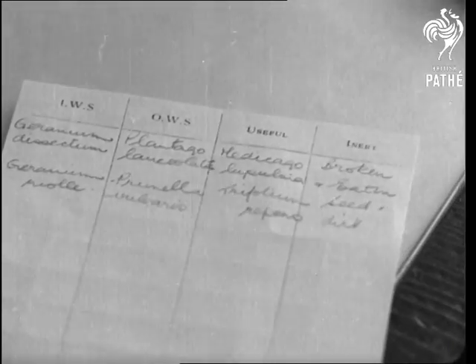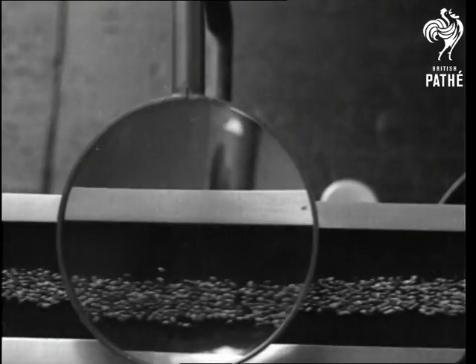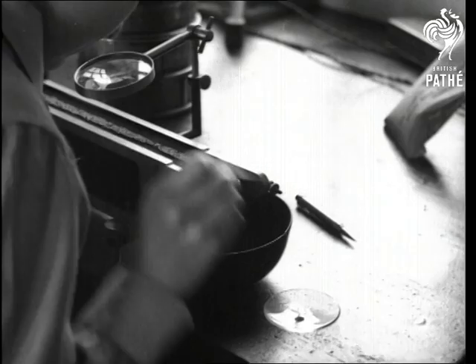The clover is examined for dodder — a parasitic plant which attaches itself by suckers to other plants and gets nourishment from them. A cynical friend says he thinks dodder is very human in this respect.